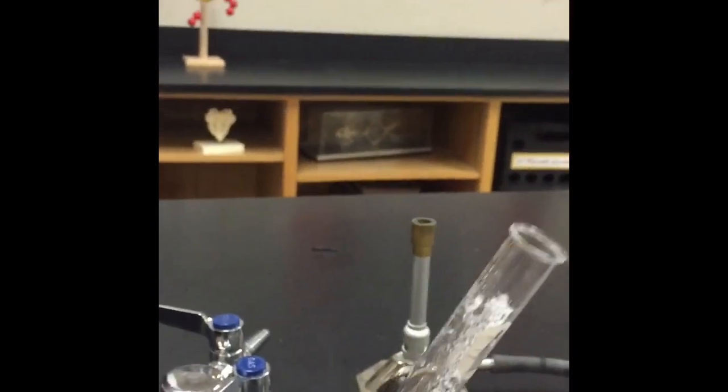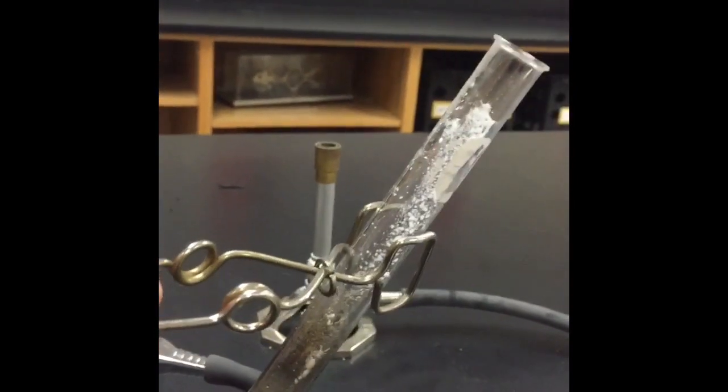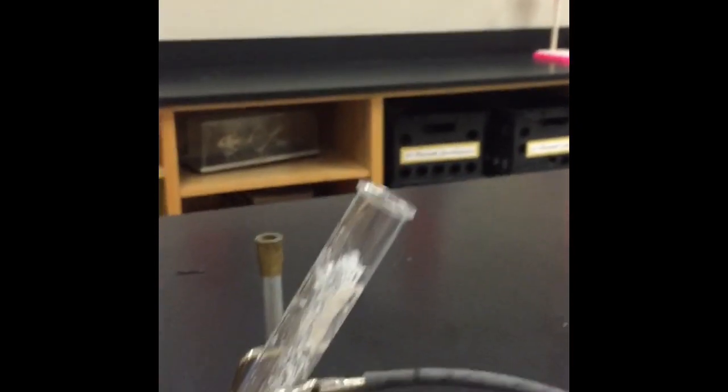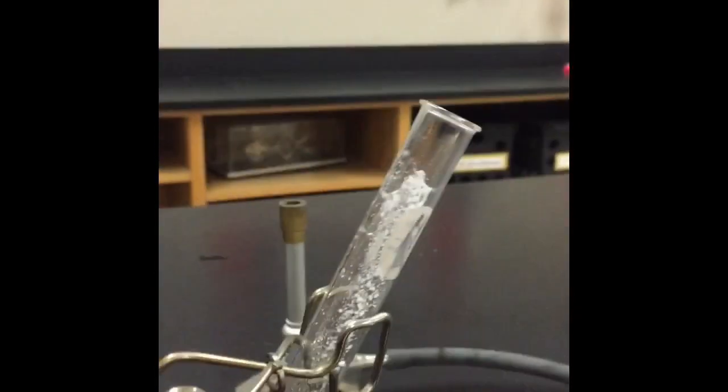And if I place a litmus test paper in the tube, I see that the litmus test paper actually turns blue. And that is due to the formation of a base. That base, I know you can't smell it, is actually going to be ammonia. Okay. There's also a second gas being produced because this is a carbonate. You get liquid water always from a carbonate, and you always get carbon dioxide from a carbonate. Okay. The third product here is that basic gas, ammonia.